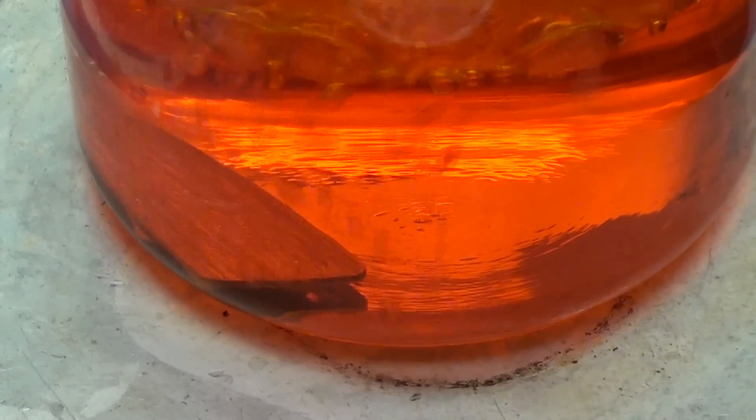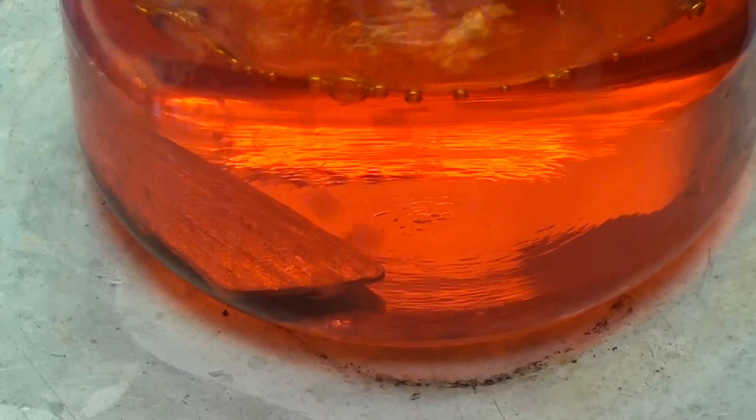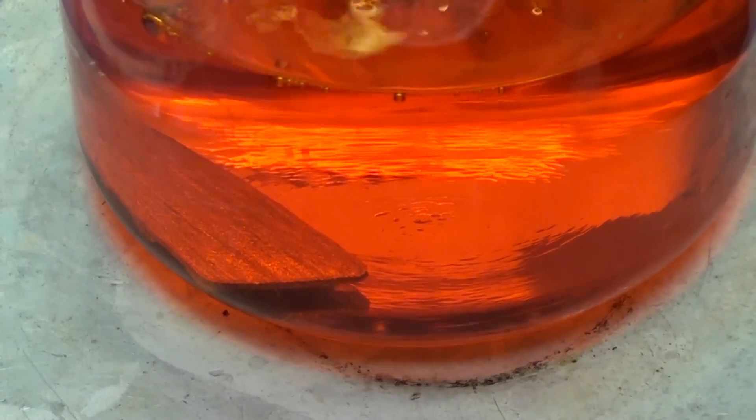This is extremely slow and every four hours I've been adding in an additional 25 milliliters of nitric acid. Platinum is much more resistant to aqua regia than gold.